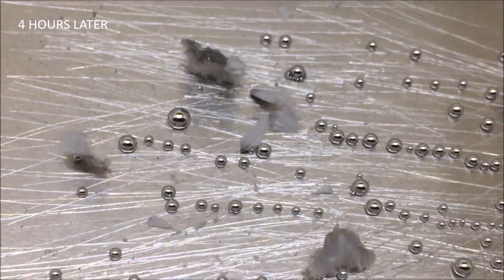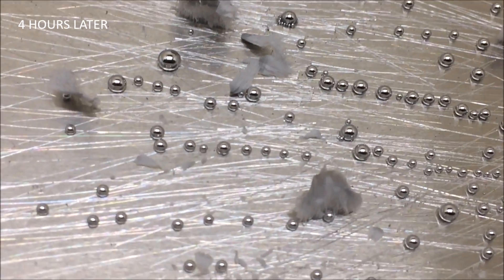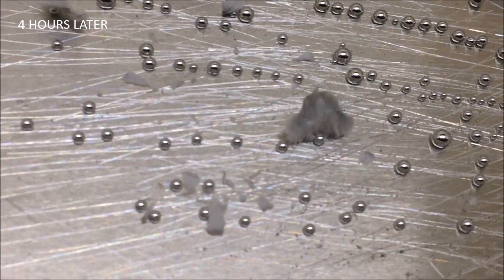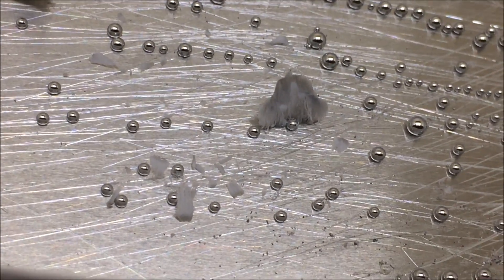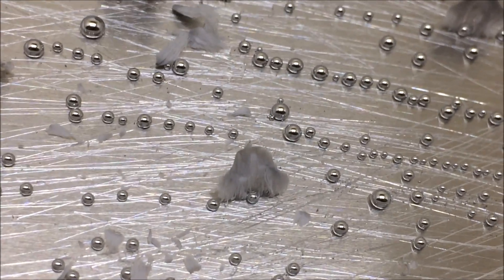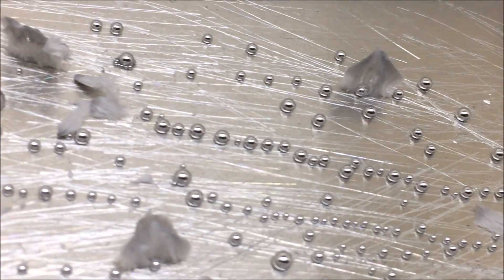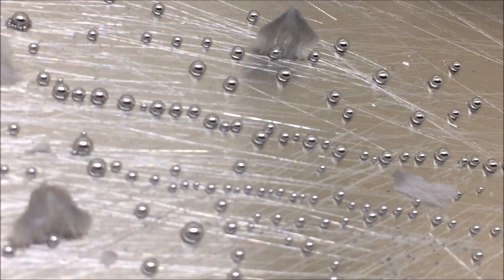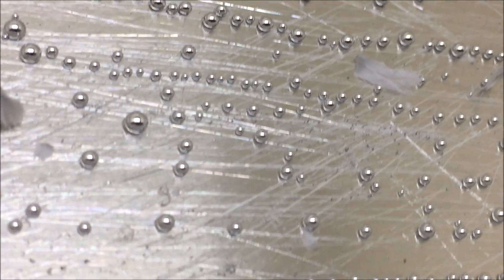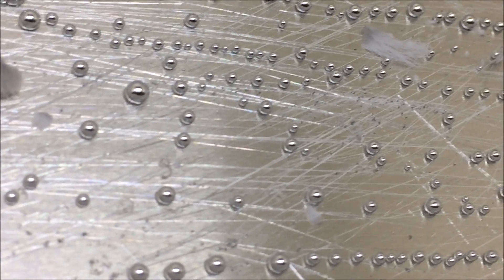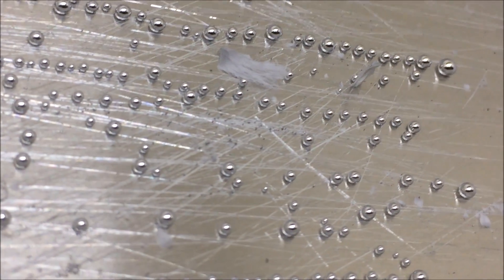And here we go 4 hours later. All mold growing business is now skyrocketing. The mold here is most likely to be amalgamated aluminum. To me, it's a bit surprising the way it looks. An alloy between two metals does not look any way like metal, which is a bit strange. Oh well, I might be wrong.